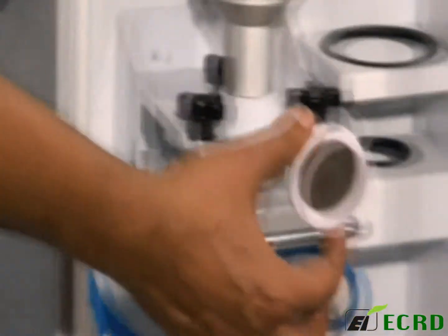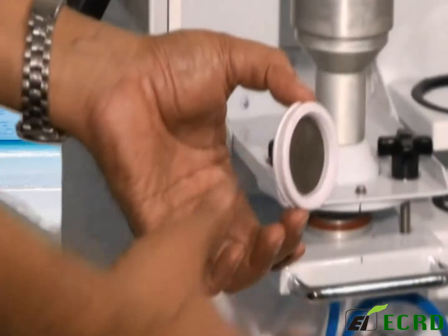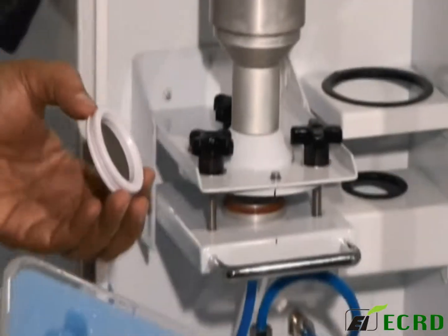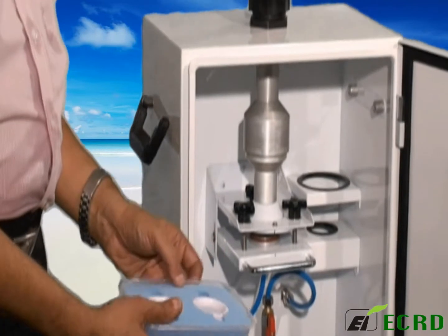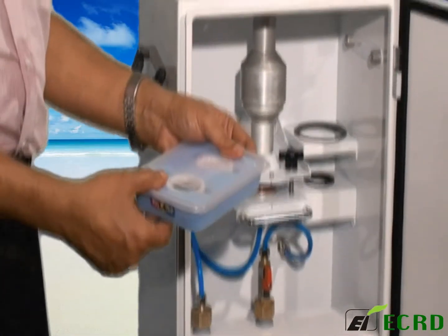You can see how much black it is — it was a white filter when we started, and this is the deposit on the filter. Place it inside the cassette holder or cassette carrier, cover it immediately, and this will go back to your laboratory.